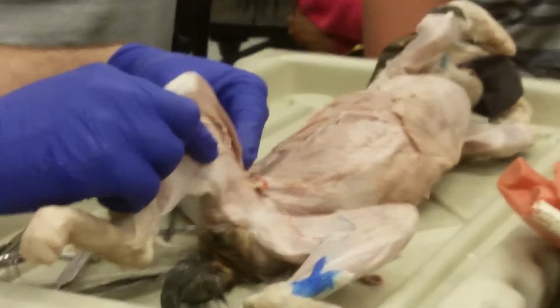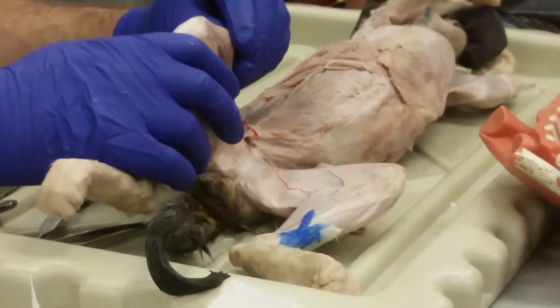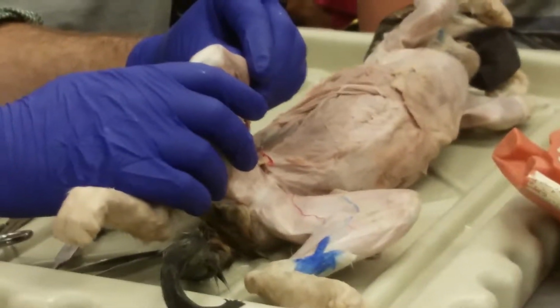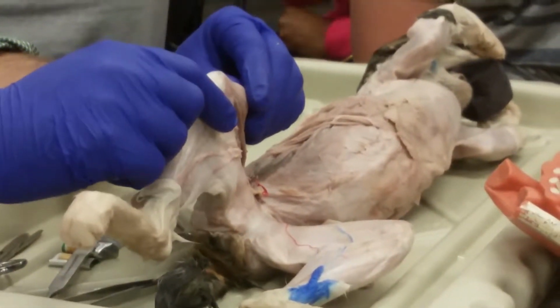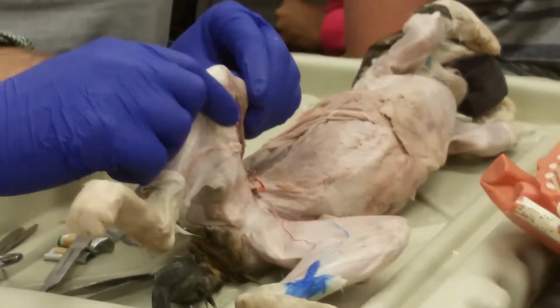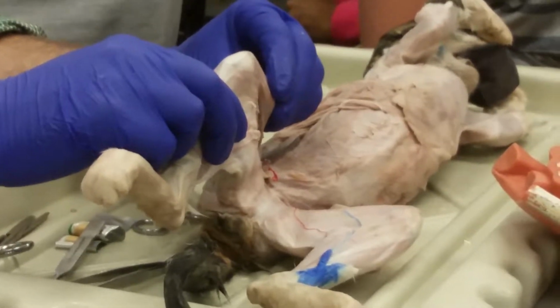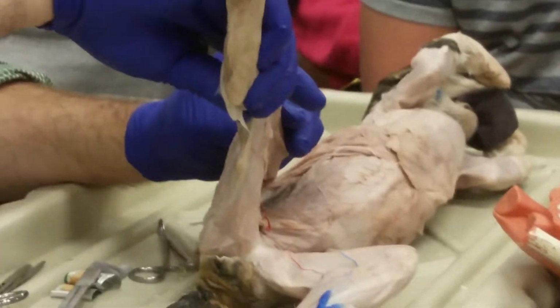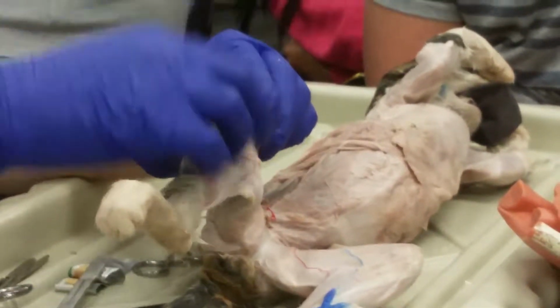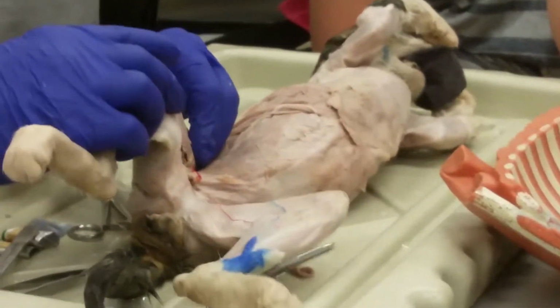Now, it's going to go down to the knee, and look, it crosses behind the knee. So it's going to pull from behind the knee. Right? Can you lay that down flat? It pulls down from behind the knee. So what's it going to do pulling from behind the knee? Extending the leg is sticking it out straight. If you pull it from behind it, it's going to flex it, right? So it's going to flex the knee. It's going to flex the hip.